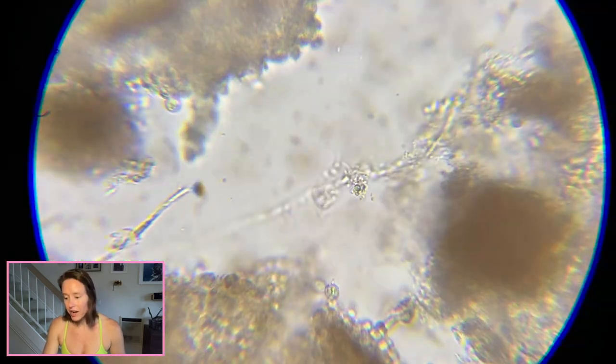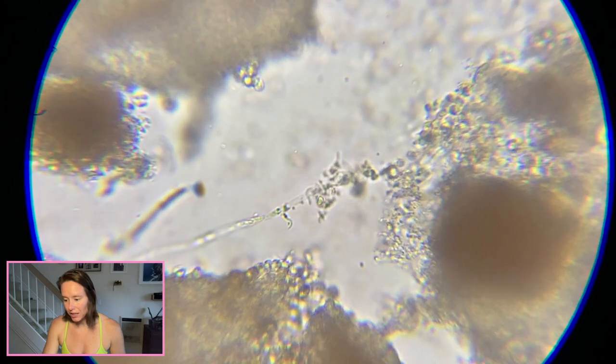So here there is a bunch of yeast and bacteria. The yeast are both oval as well as elongated, and I saw a few spots where there were very long hyphae, very long hyphal strands. There's also some oval-shaped yeast in here as well, so it's not just these spherical yeast.